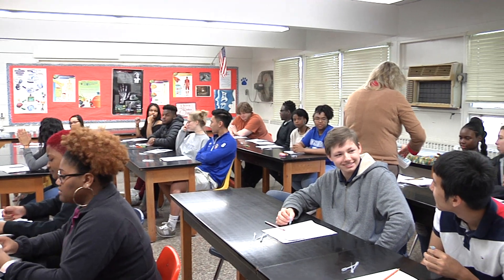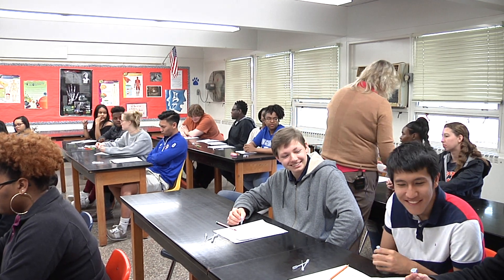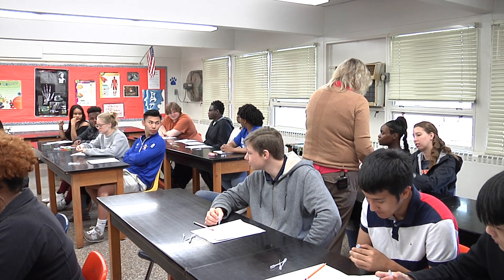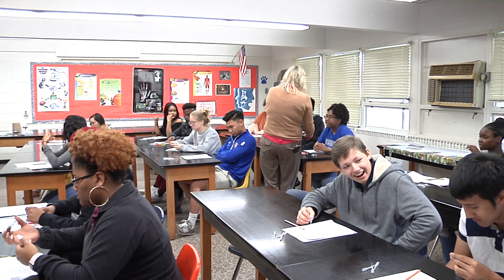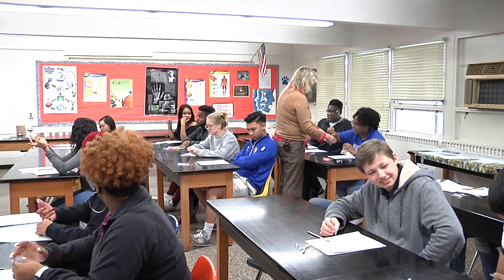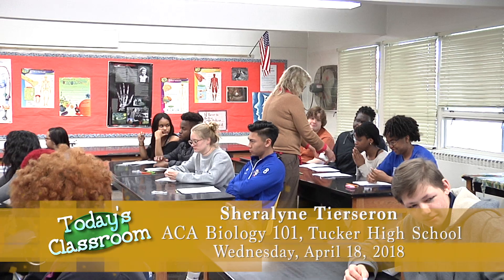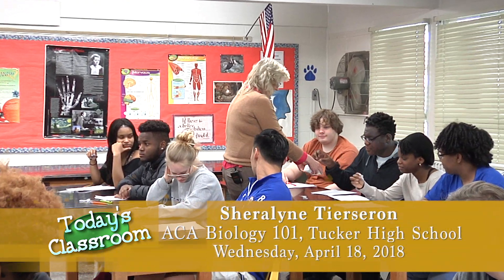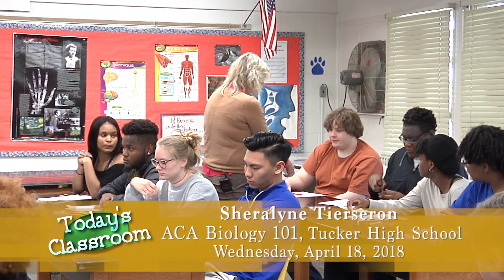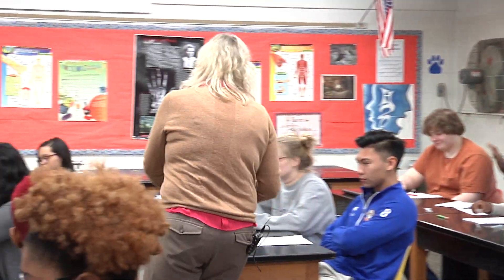17. Okay, 17. 19 is out because we're missing a person. So there's only 18 samples available. What you have in here is a small volume of simulated saliva. They've been refrigerated for a little while. There are 25 samples but only 18 people, so you can't take certain ones.